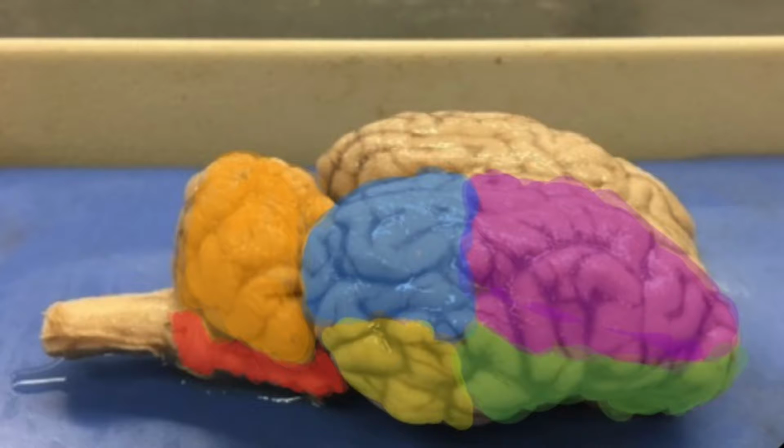The back portion of the brain, labeled in orange, is the cerebellum. Proportionally, it is much larger in a sheep than in a human. It controls voluntary movement, balance, motor and sequence learning, and reflex memory. Sometimes the cerebellum is referred to as the little brain. The red underneath the cerebellum is the brainstem. The brainstem connects the brain to the spine.